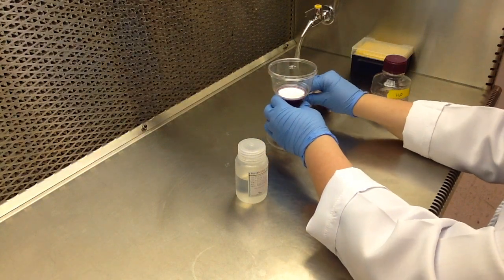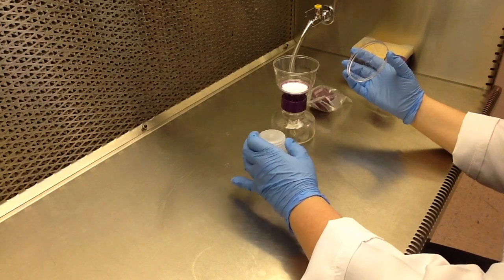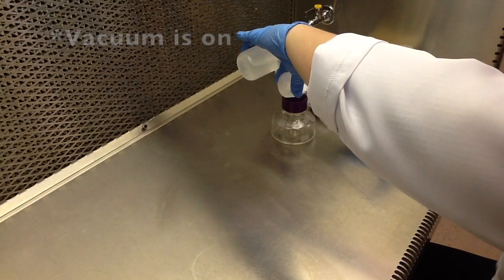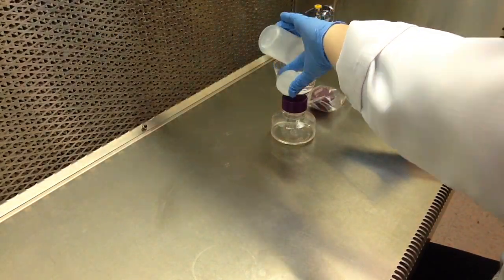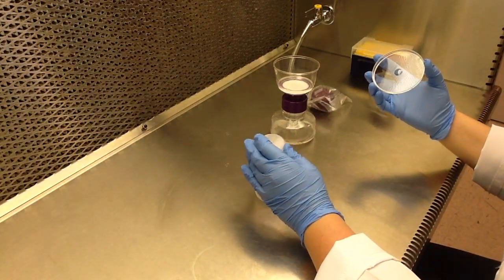Attach the vacuum hose according to instructions on the filter packaging. Remove the lid and add solution to the upper cup of the filter. Apply the vacuum pressure and let all the solution in the top cup flow through the filter and into the bottom cup.